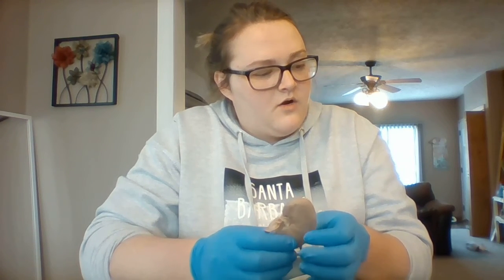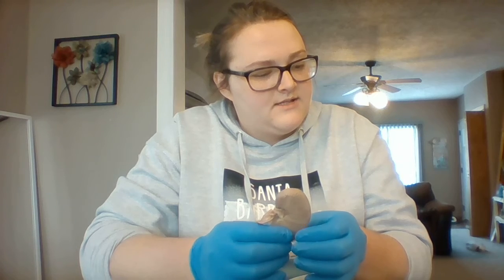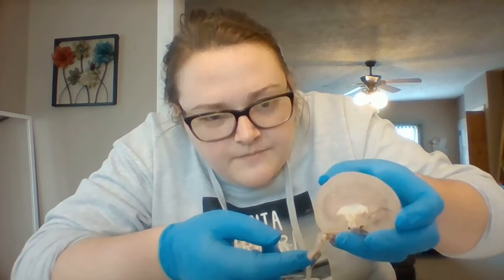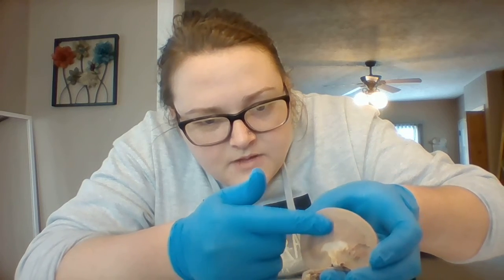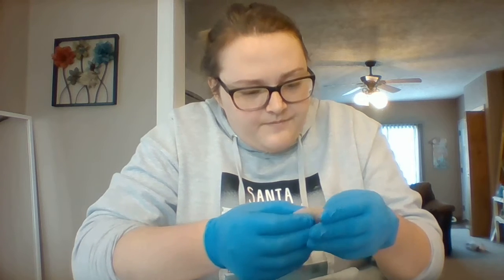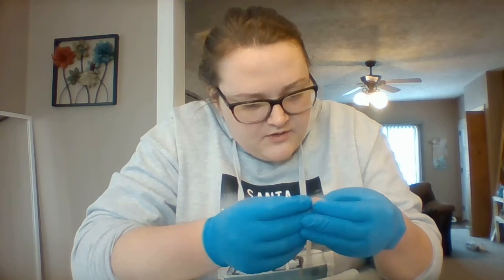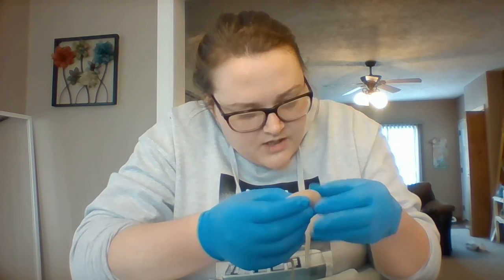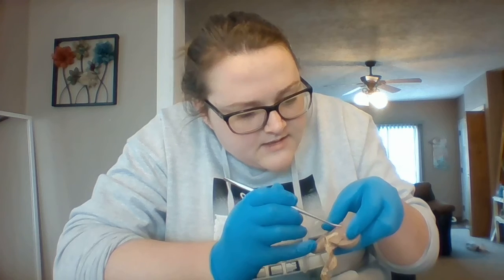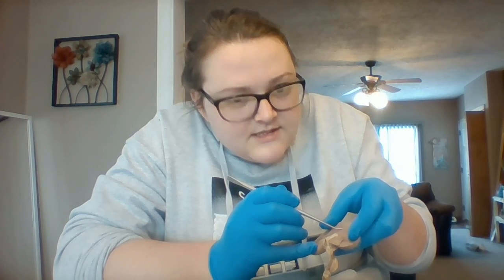The renal pyramids are cone-shaped structural units. They're kind of hard to see on here, but you can kind of see them. They're right in there. Just slightly different color, and you can differentiate them, especially if you use the probe. Can see the different units there.